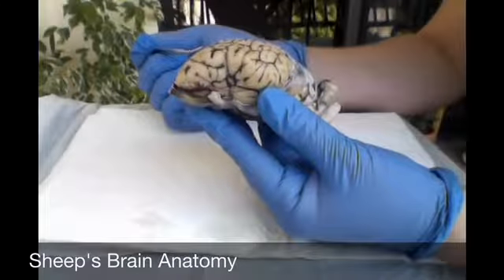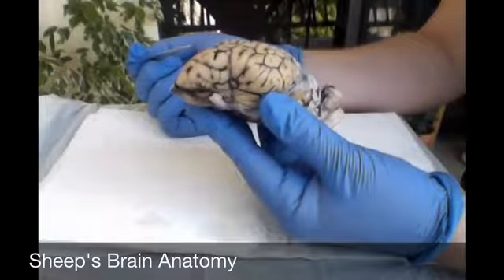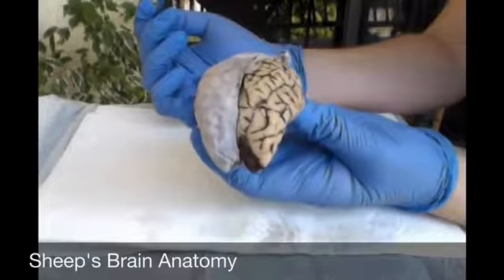Hello, my name is Camille Wiseman, and today we will be dissecting a sheep's brain. And that's what this is right here. What you're looking at is the left hemisphere of a sheep's brain.